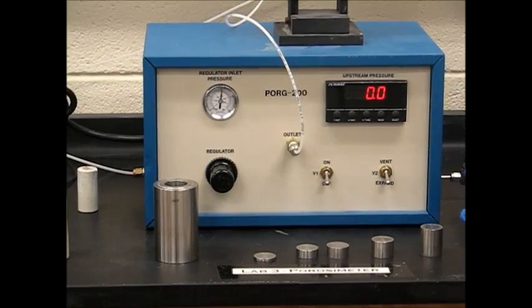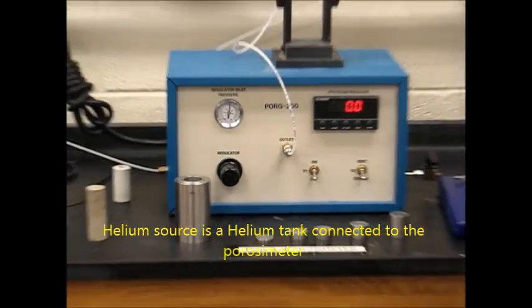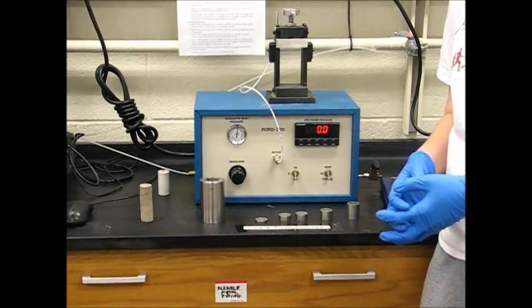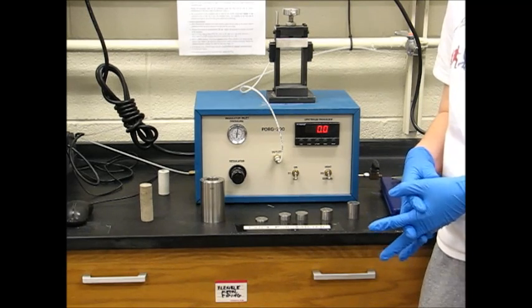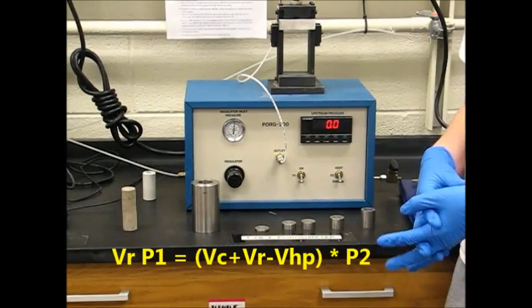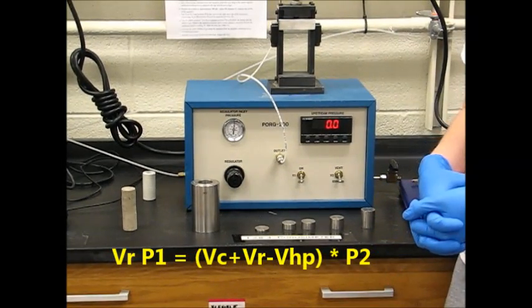The reference pressure is pressured to be around 100 psi, which comes from over there, and is expanded into a matrix cup sample holder containing the sample to be analyzed. A second pressure is read and used to compute the unknown volume. The following equation is often used to derive grain volume.